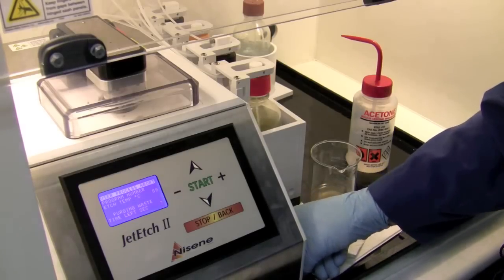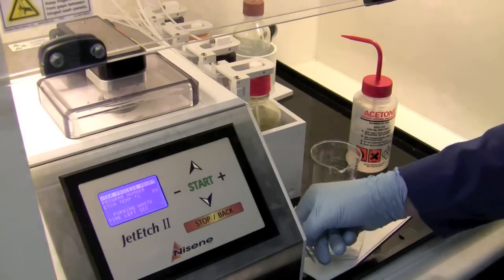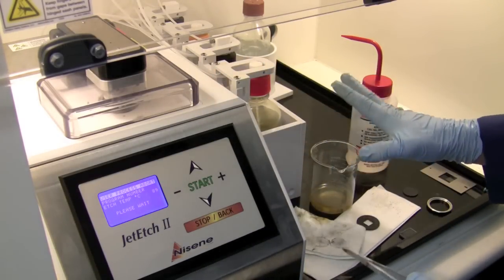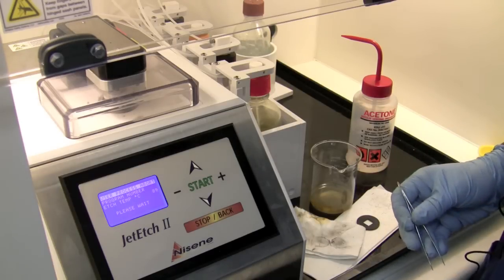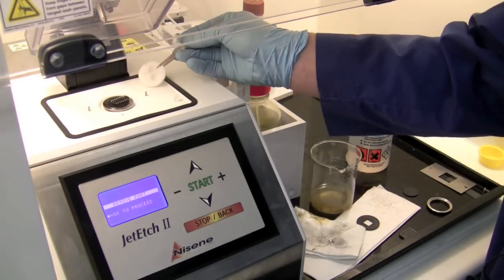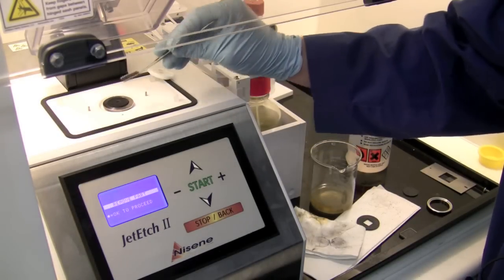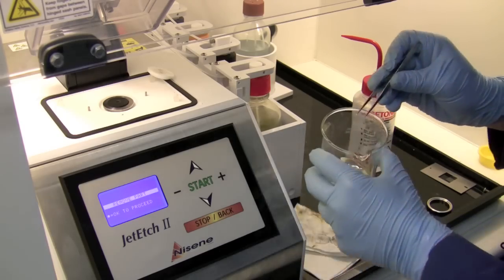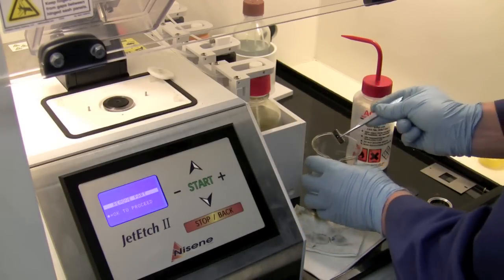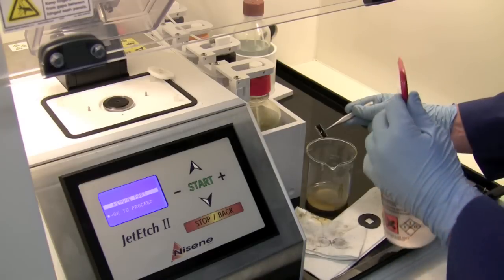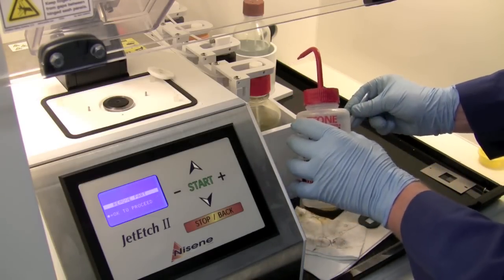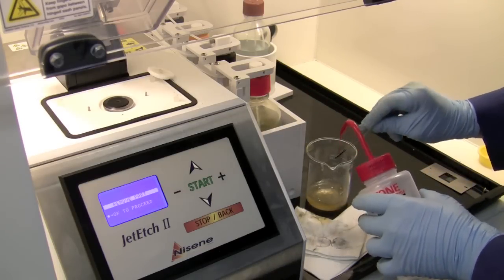We're coming to the end of our etch time, it's doing a waste purge. What I'm going to do is go directly from my etch head with my part and my gasket and give them a rinse in an acetone bath. Remove the teflon blank, take my IC—I can drop that in this bath here and then I can fish it back out, or you can just hold on to it and rinse it off with your acetone bottle. And since we're using nitric, we want to be using the acetone, red with red if that makes any sense.